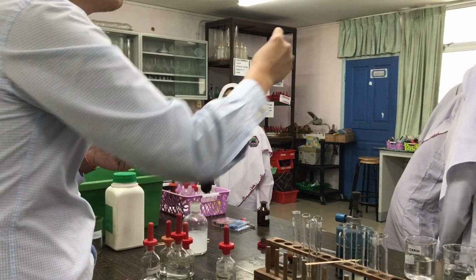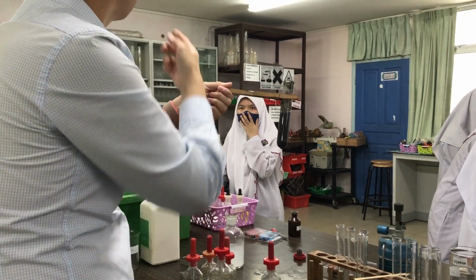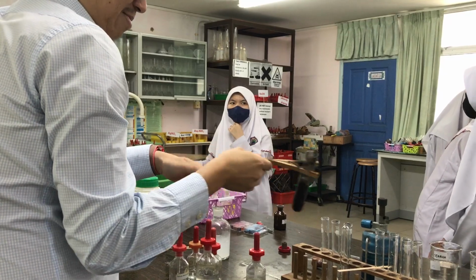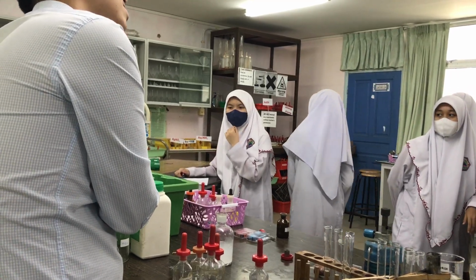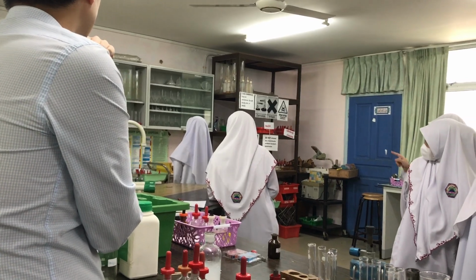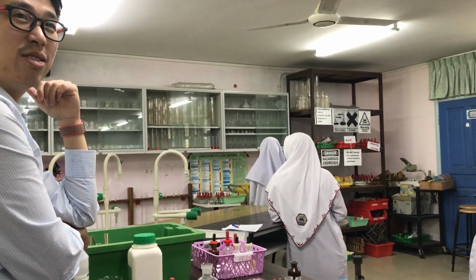Why does filtration work? So, what apparatus do you need for filtration? Go and grab me the apparatus for filtration. So we will see as she picks her choices. Maybe she doesn't know.